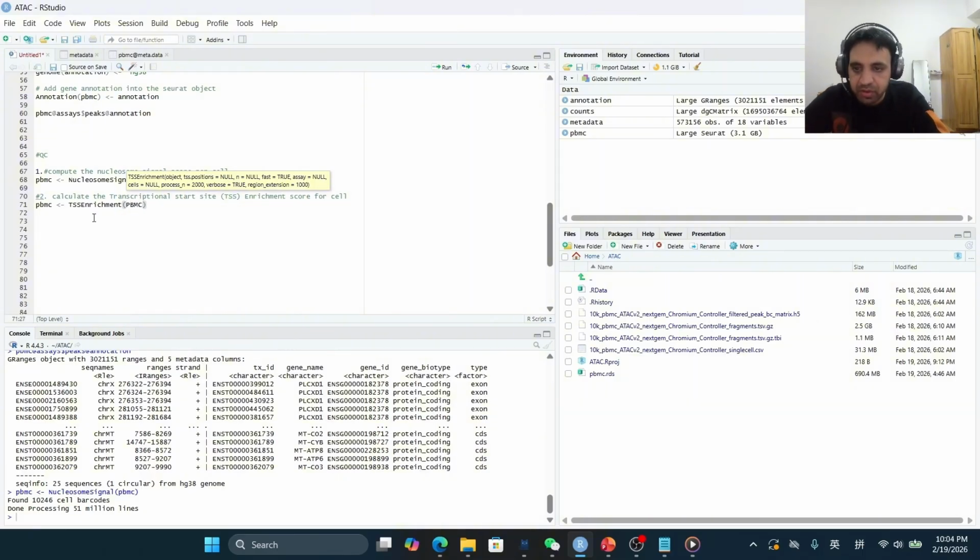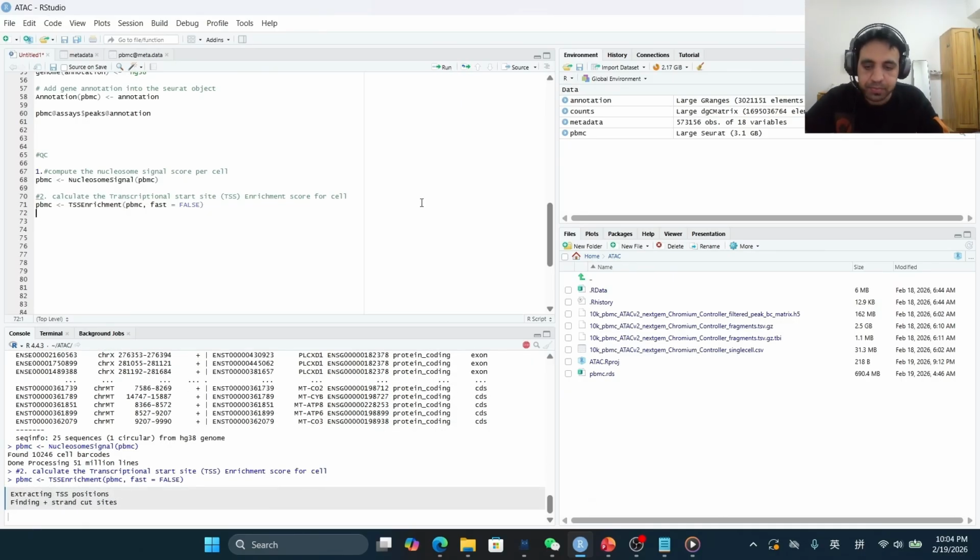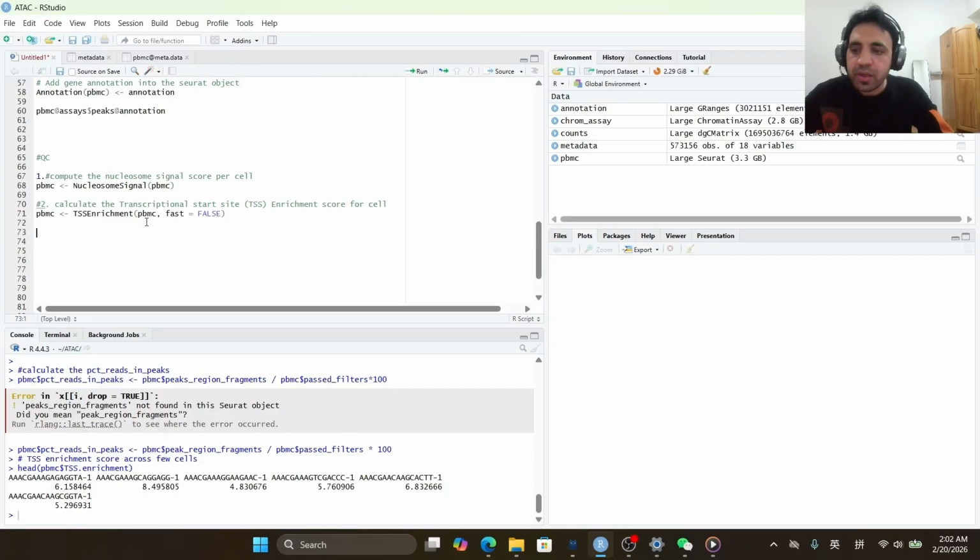So PBMC, and the key parameter includes fast equals false, which will be slow on large datasets but very efficient. So run. It will take some time. Finally, after taking some time, the TSS enrichment score has been calculated, and now we will look into the TSS enrichment score across a few cells.